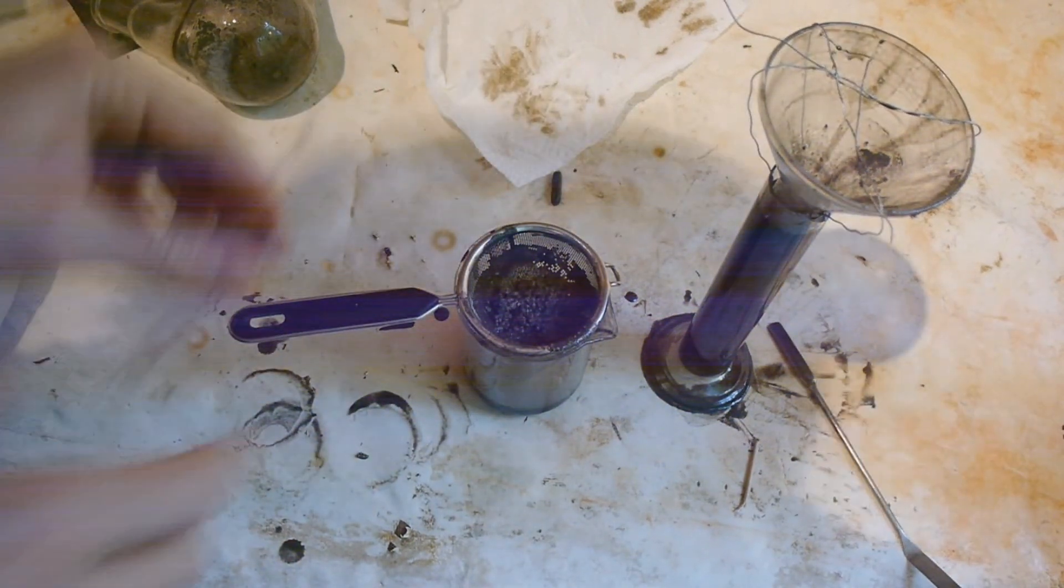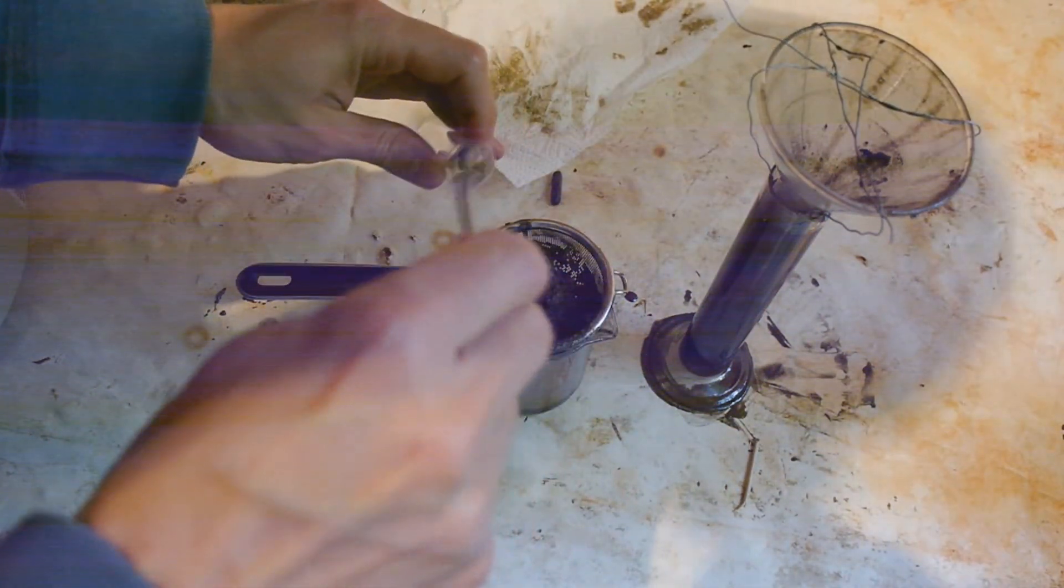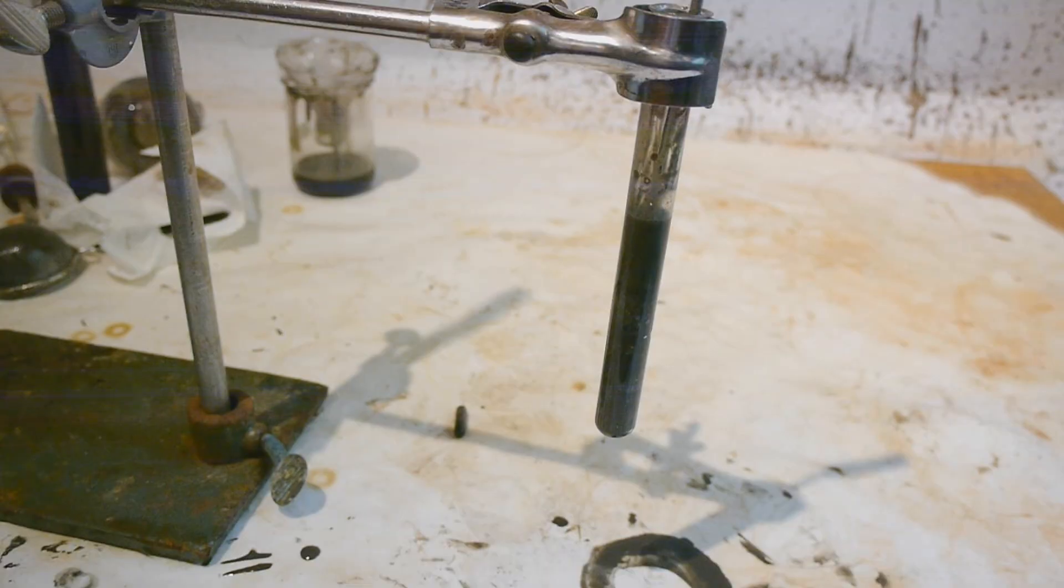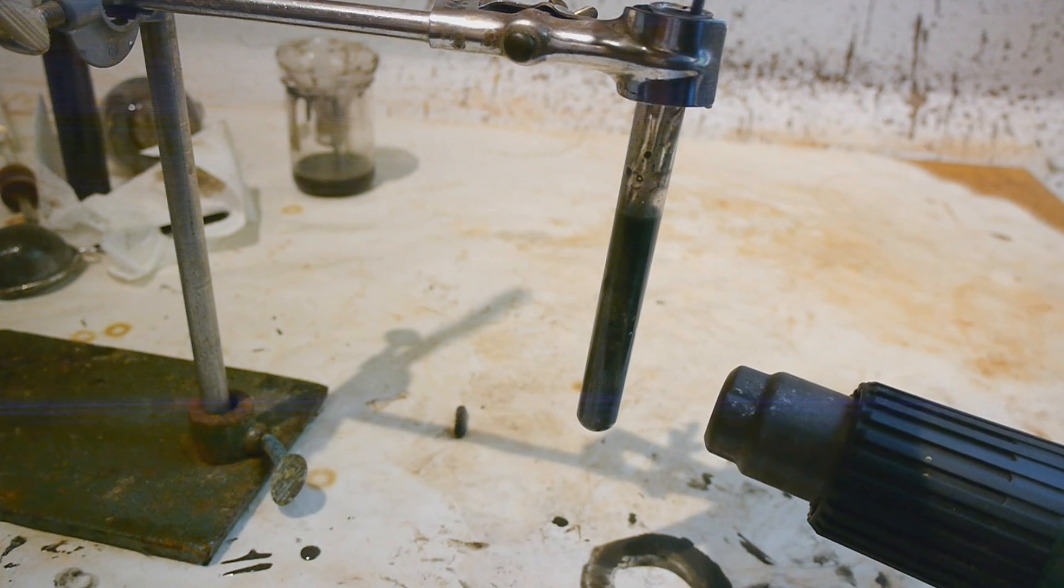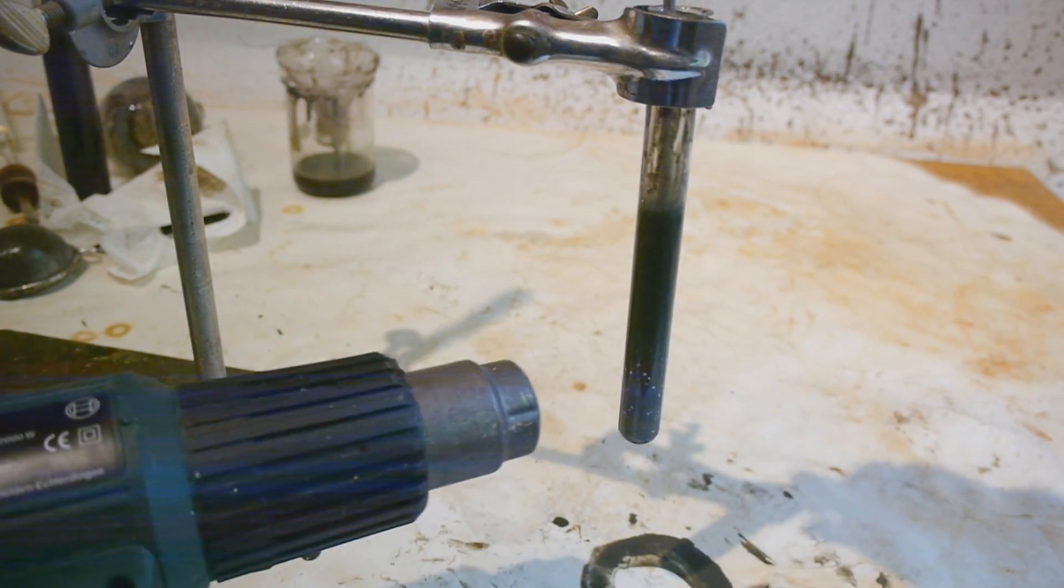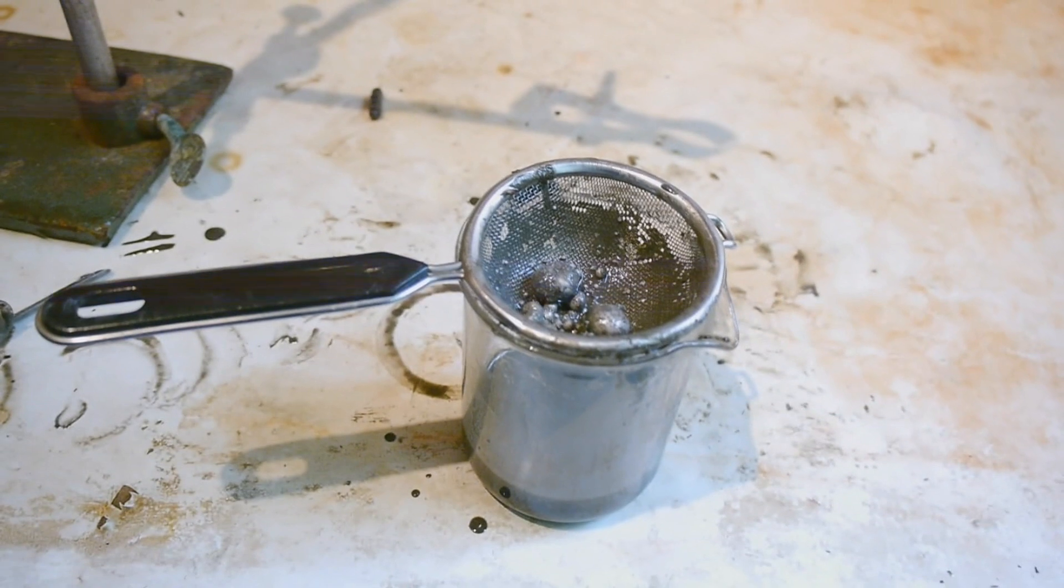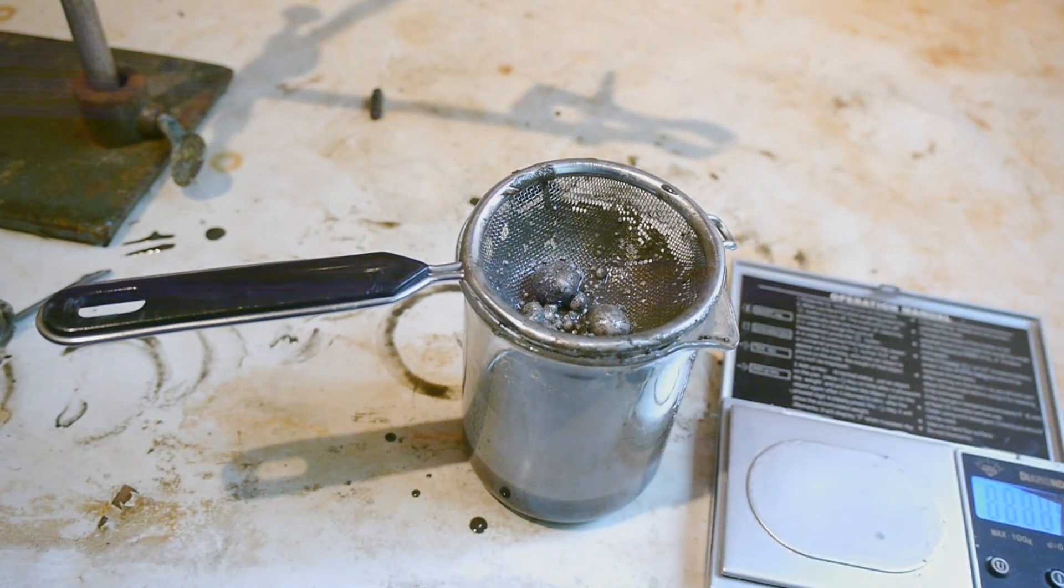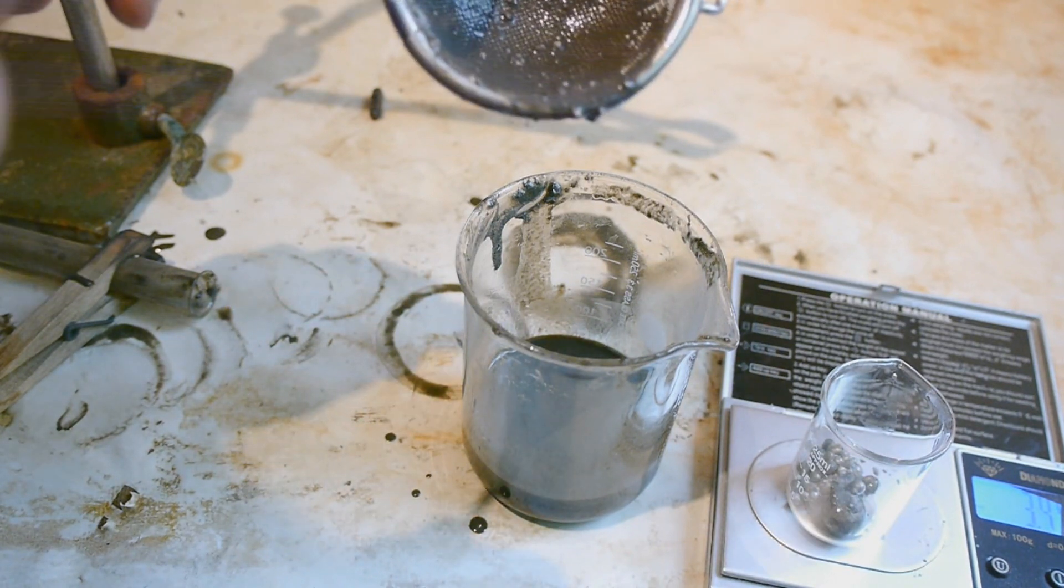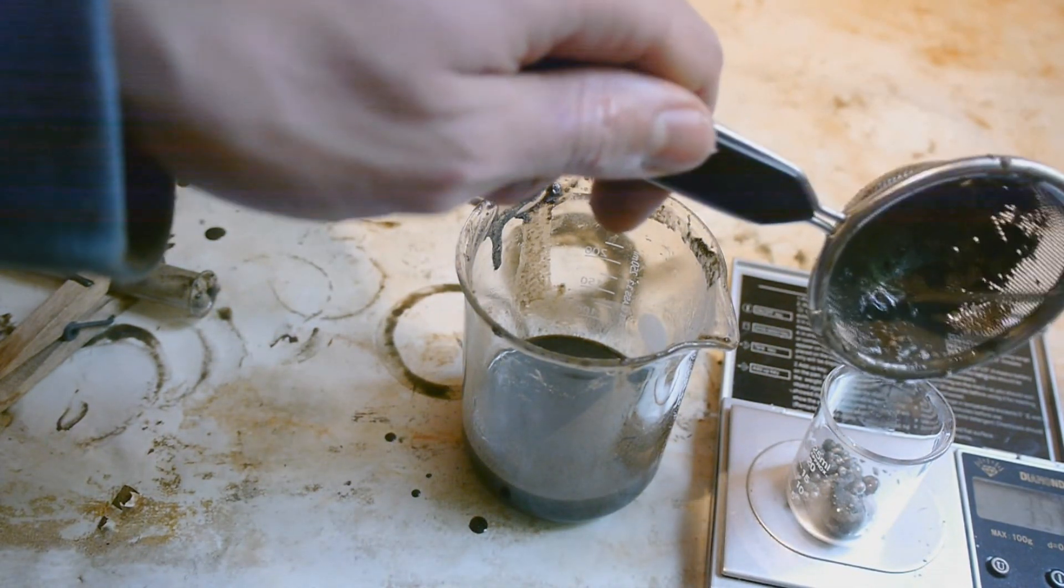Okay before I try to work up this giant royal mess, I'll try to secure what I've collected so far. So let me transfer this into the test tube and let's add some of this leftover mineral oil. And now let's try to melt all this together. Some sodium must have been stuck on the outside. It was scary. Okay it looks like this is working at least. Okay the sodium has cooled down and I've filtered it off again. And it looks like we've improved the situation. Now let's try to weigh this first result. Okay so it's basically the sodium that we started with back. Well, well, well. So let's say we got a yield of 0%. I guess I just have to try this again. I mean I didn't lose anything valuable. I mean even the sodium isn't really that valuable. So that's all the paraffin oil with the residues from the first reaction and I'm guessing there is still a lot of sodium in there. But before I try to isolate that I will just make a second attempt.